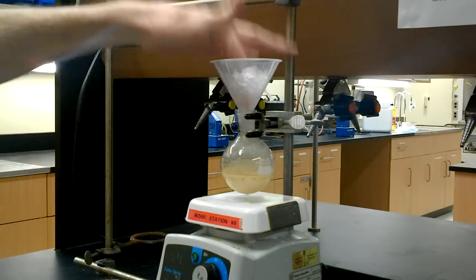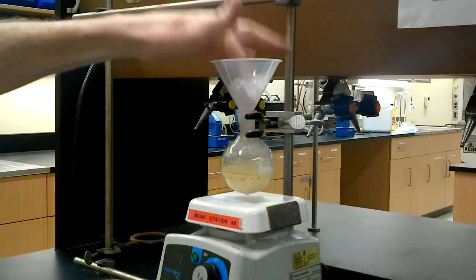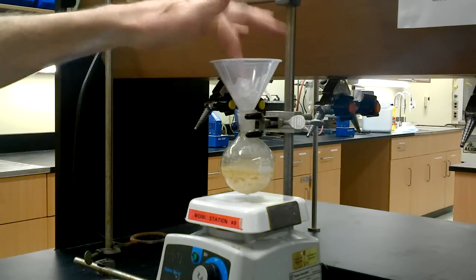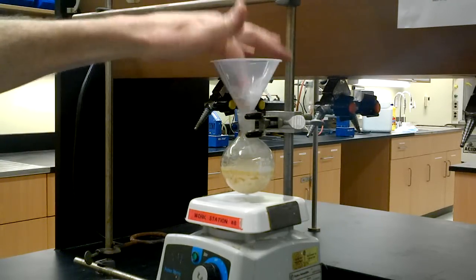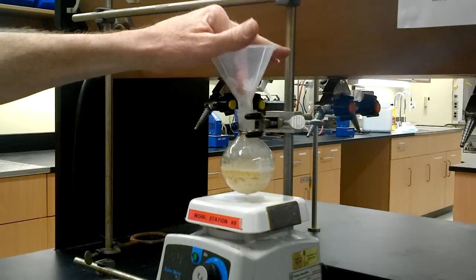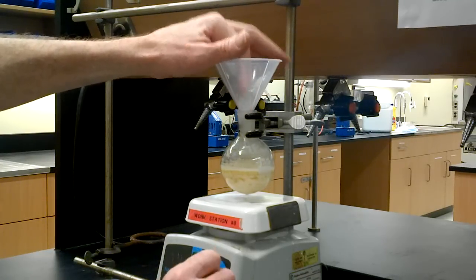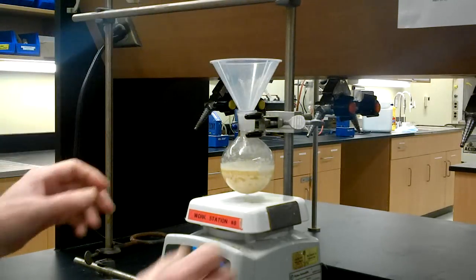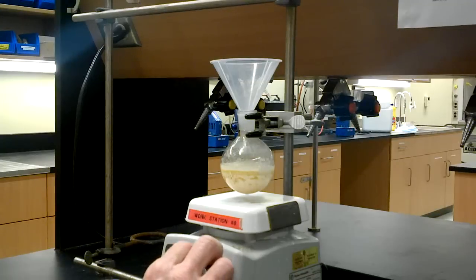Looks like I'm going to need something to poke in. So we keep stirring, and quench our reaction, and our solid product should precipitate from the solution.